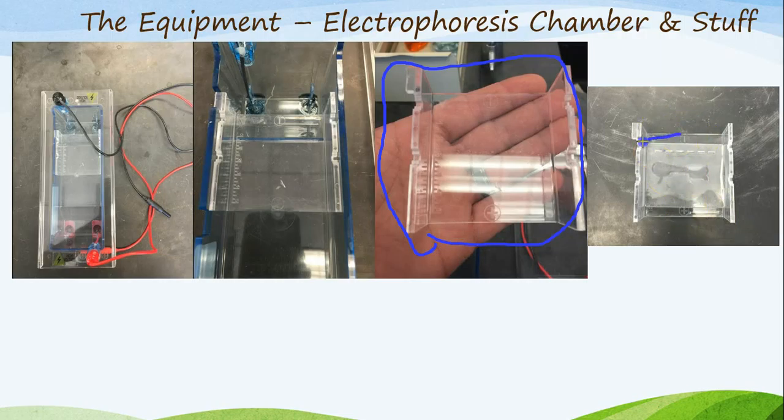The gels are created by your teacher. However, if you would like to know how those gels are made, feel free to ask your instructor and he will show you how simple and dummy-proof it has become. When you obtain your gel, you're going to lay it flat, well side up on your tray. The wells are these holes cut into the gel itself. Once you have your gel placed on top of your tray, very carefully, I might add, because the gel is extremely delicate, about as delicate as Jell-O itself. Because, let's just be honest, it pretty much is Jell-O.